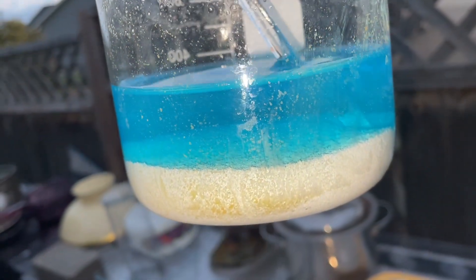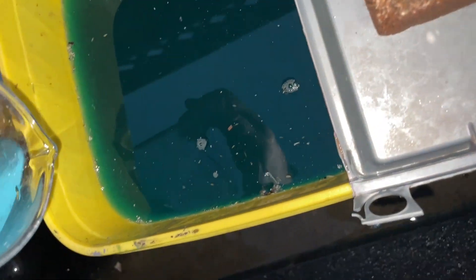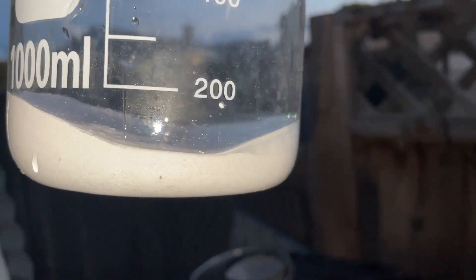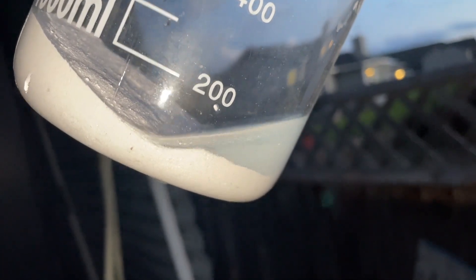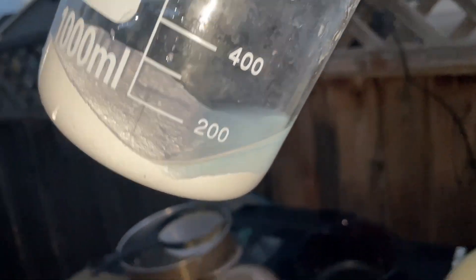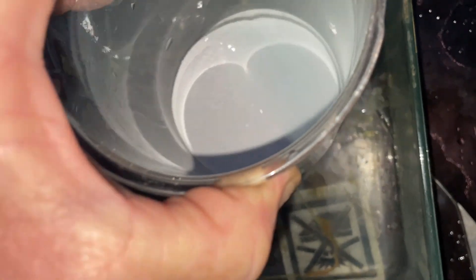Look — there are the cleaned up chlorides here. Just about perfect. They're not exactly perfectly clean but pretty close. You see a slight tinge to that water? It's got some silver chloride suspended in it too, makes it cloudy looking. But as far as a blueness color, maybe just a tiny bit compared to the whiteness of the chloride. It's got a little blue tinge still.